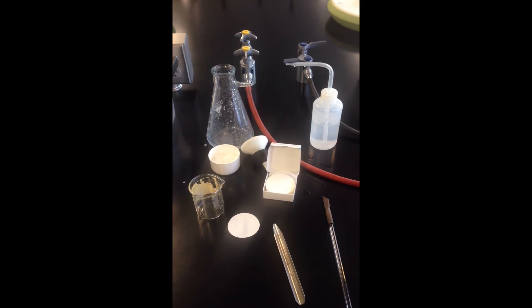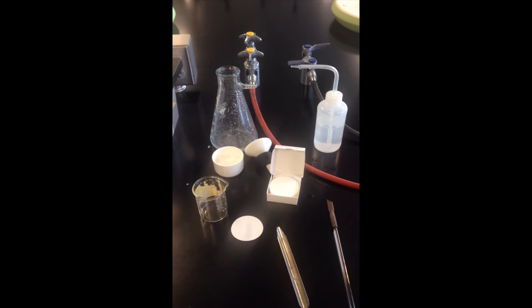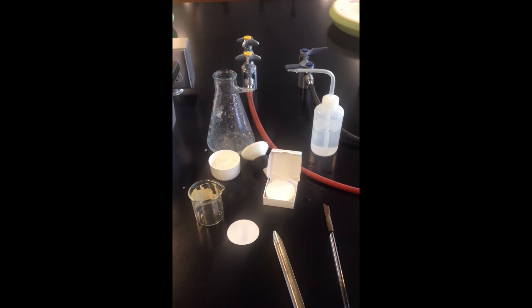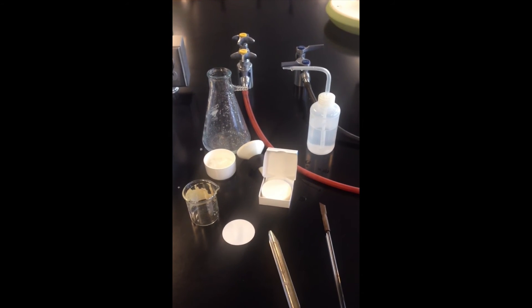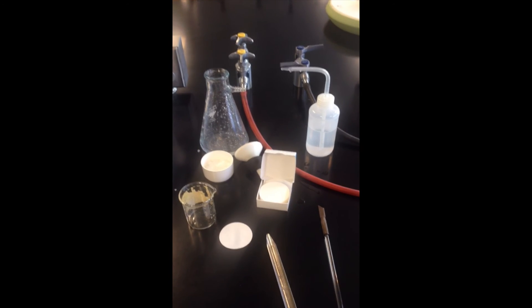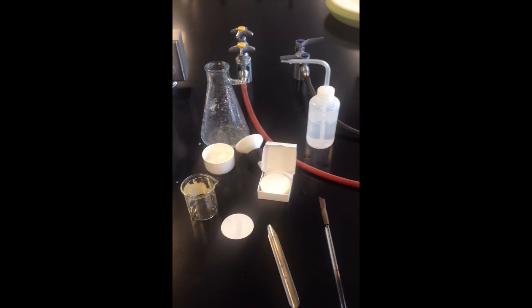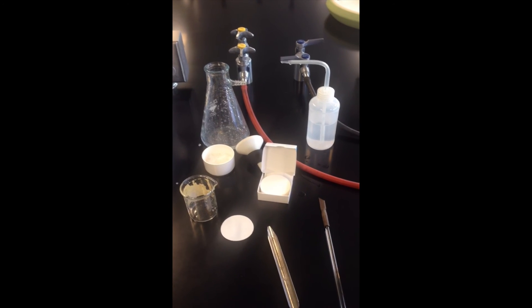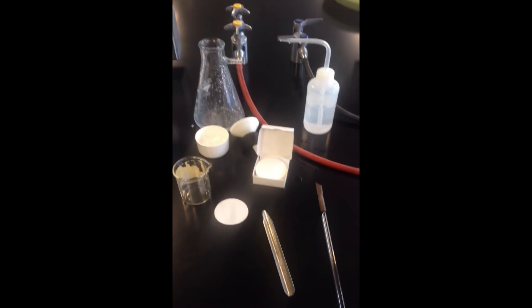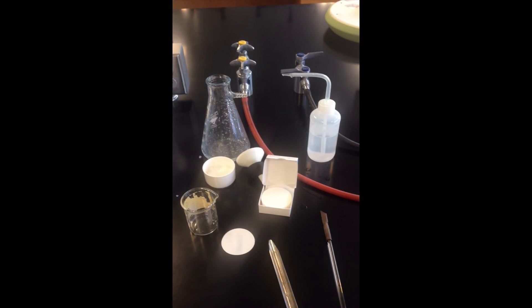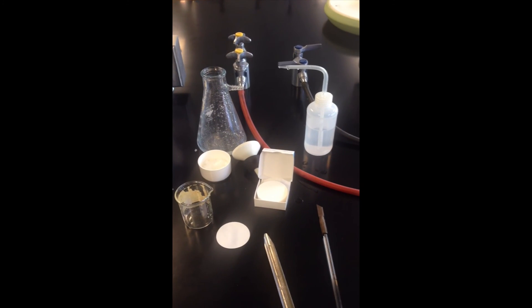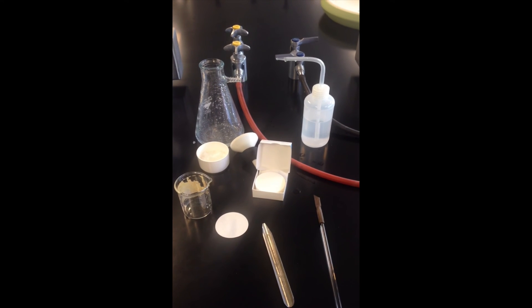One last thing I want to mention here is that in the demo we did here, the alum crystals are pretty large and pretty bulky and boxy, so they tended not to impede the flow of water through the Buechner funnel. If you're working with a much finer powder or a powder that's present in a much larger amount, what you may find is that the filter gets plugged up and the water refuses to flow.